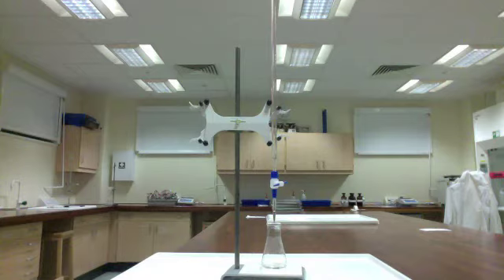What we're going to do here is figure out, A, the concentration of this sodium hydroxide, and B, learn how to properly do a titration. Once we know the concentration of this sodium hydroxide, you will go ahead in your labs over the next few days and do some sample analysis. We're going to be analyzing two different consumer products: one is vinegar, one is aspirin tablets. You will be following these exact same procedures in your sample analysis for how to do a titration. So be sure you pay close attention.